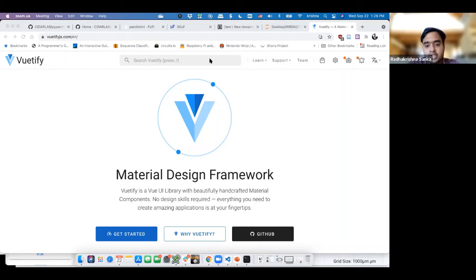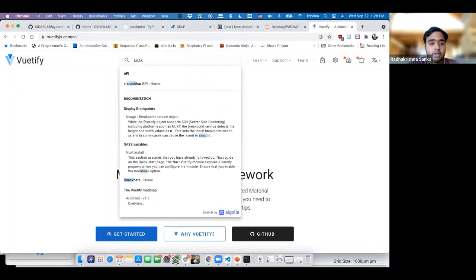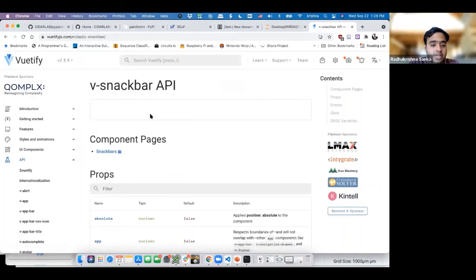Now, I don't know how to add a snack bar, right? Like most of you don't know how a Vuetify snack bar works. So we're going to go to the Vuetify website, click on the search over here, and I'm going to say snack bar. So I can go to the API where it gives me the details on what a snack bar is.